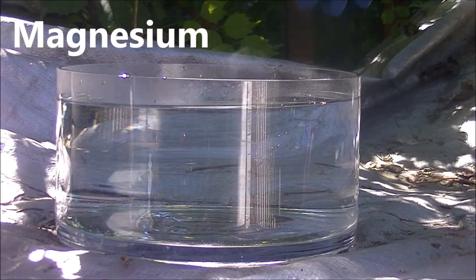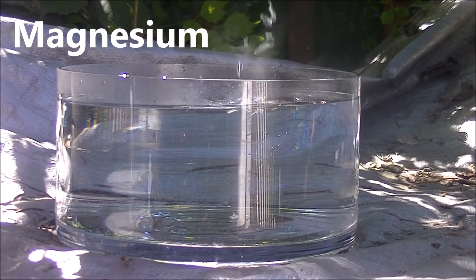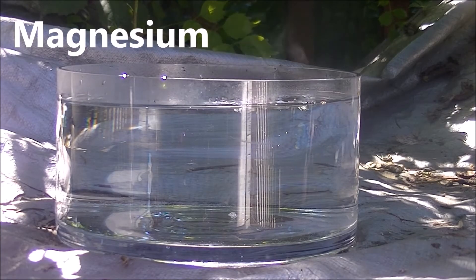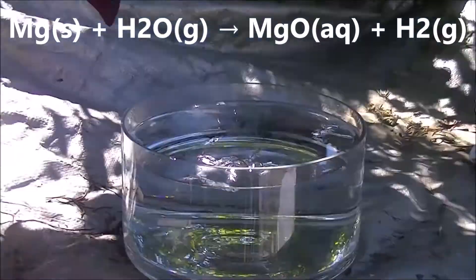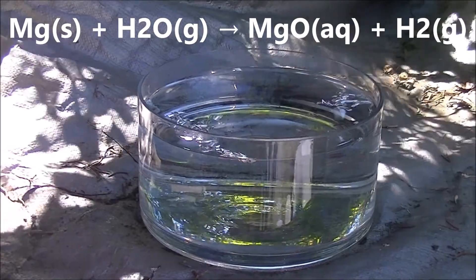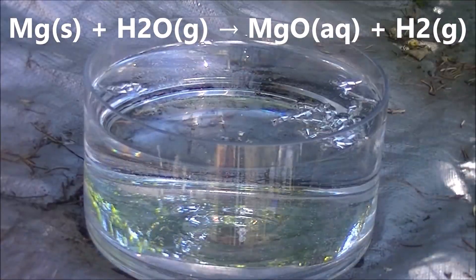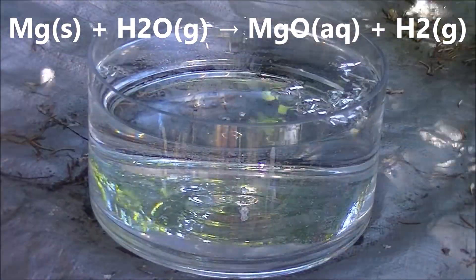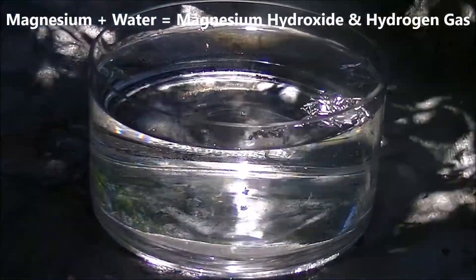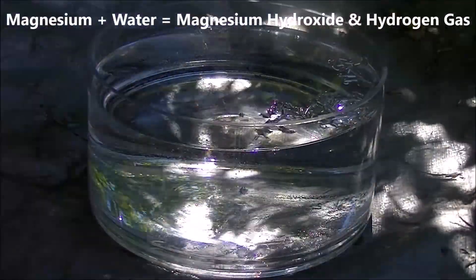Here's magnesium. Magnesium does react with water, but very slowly. I sped up two and a half hours of footage so that you wouldn't get bored.